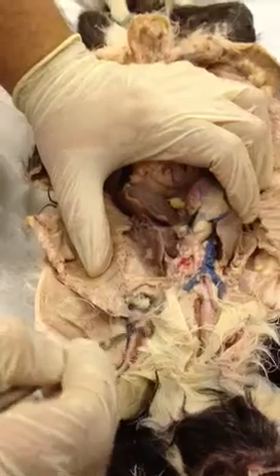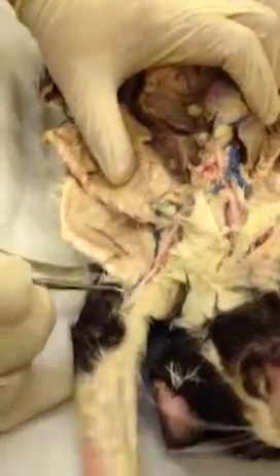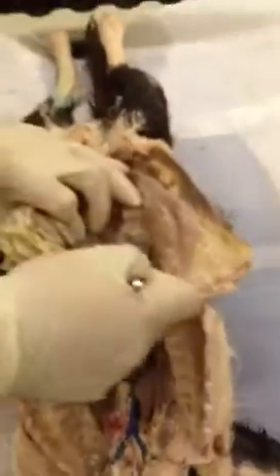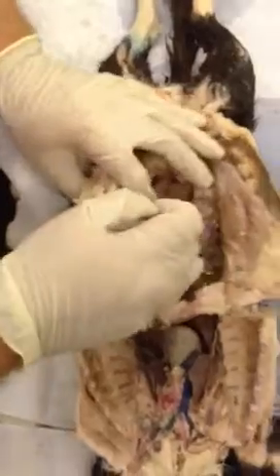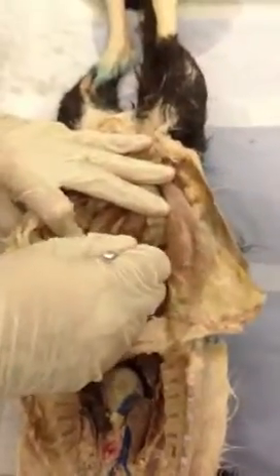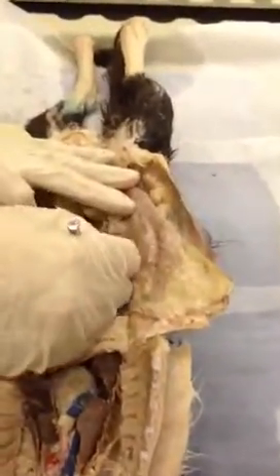It's going to come over and around the armpit area. It's going to be called the axillary, right? And then when we get into the arm, it's going to be called the brachial, which we're going to see it a lot better in some of these other cats over here. Here, what organ is this? Kidney, and we can see the renal artery and vein coming into the kidney. So here we have, what structure is this one going to be? That's going to be draining blood, inferior vena cava, right?